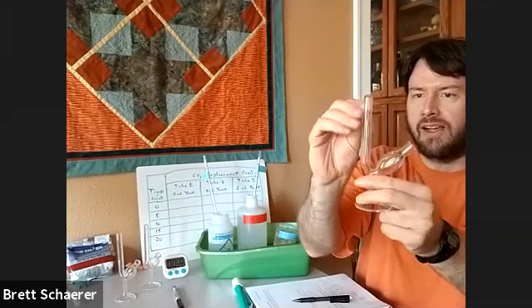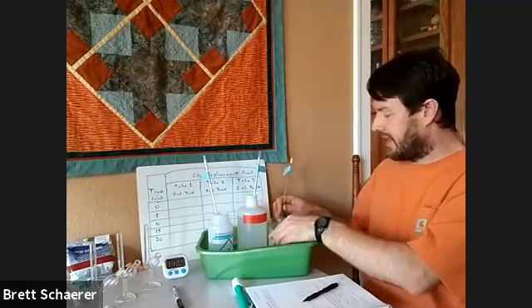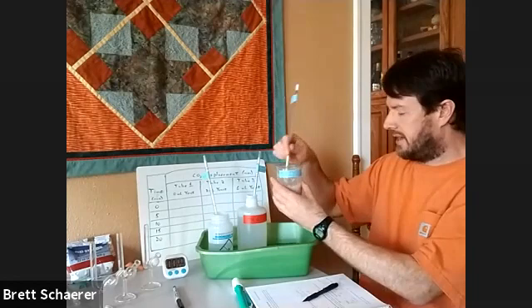Before we get started, I'll kind of show you what we're doing. We have these fermentation tubes here, which will provide an anaerobic chamber for fermentation to occur. Gas can collect in the tail of this fermentation tube, and we can measure the size of that gas bubble as the fermentation progresses. We've got a timer, some water, some 30% glucose as a sugar source, and a yeast suspension. I have all these in a tub of warm water to get things going a little more quickly from the start.